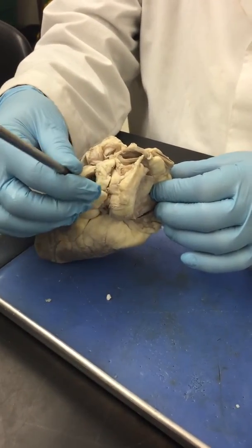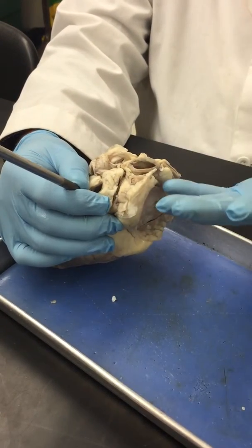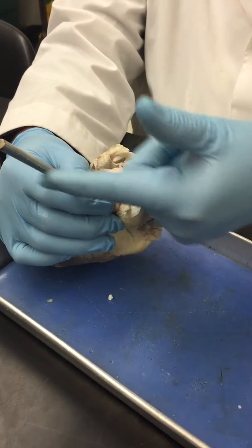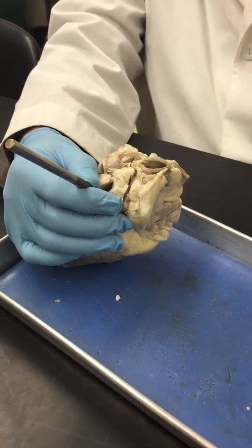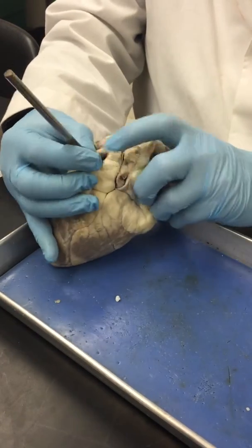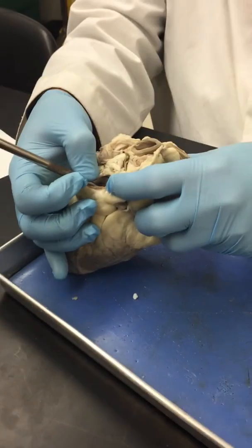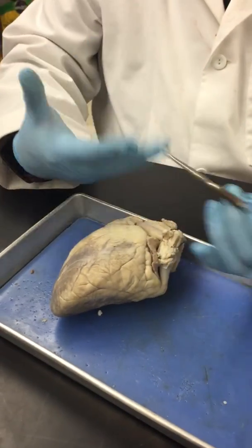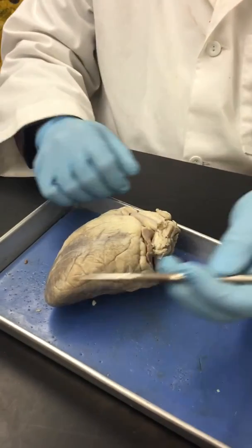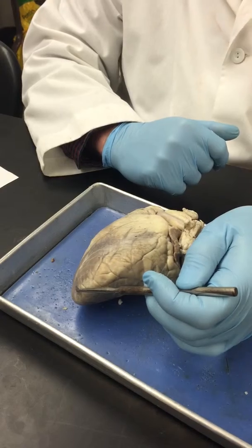Okay? So again, because all of these blood vessels are cut, I'm using probes, so the practical will say, you know, what vessel does my probe represent? In this case, you would say pulmonary vein. So there's 4 of those, and it's a pretty big opening there that 4 will get into, so that makes sense. Okay, the apex of the heart, again, is not the top of the heart. The apex of anything is the top. Well, this is the apex of the heart. It's the bottom tip.